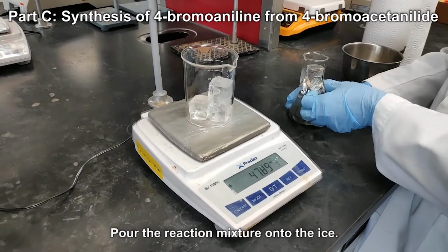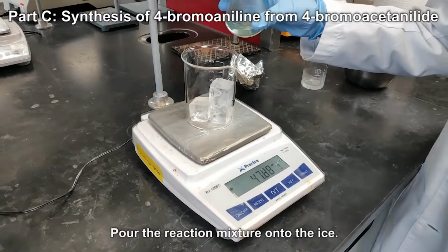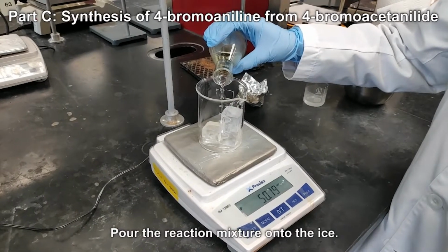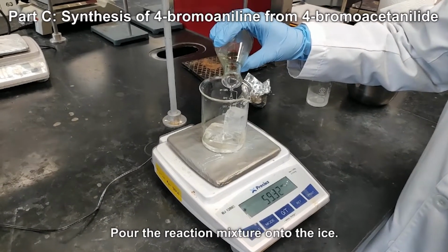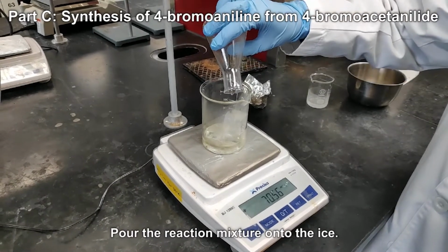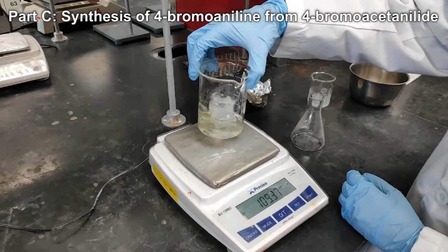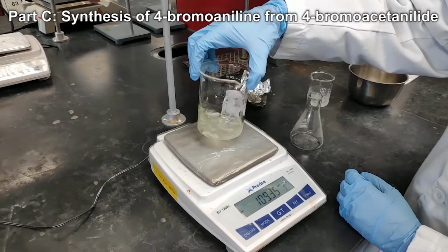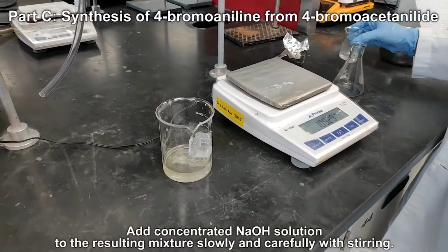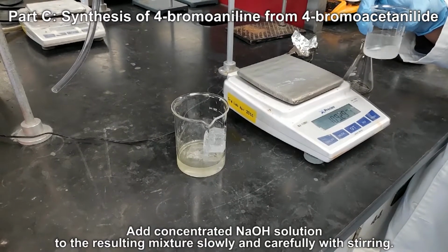Pour the reaction mixture onto the ice. Add concentrated sodium hydroxide solution to the resulting mixture slowly and carefully with stirring.